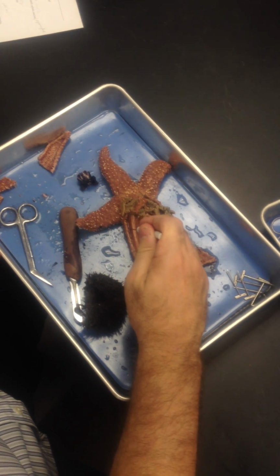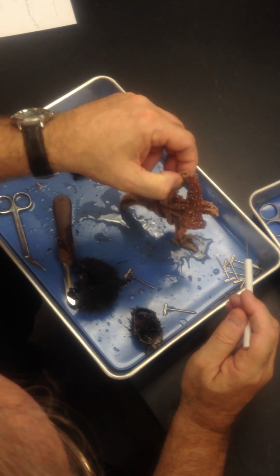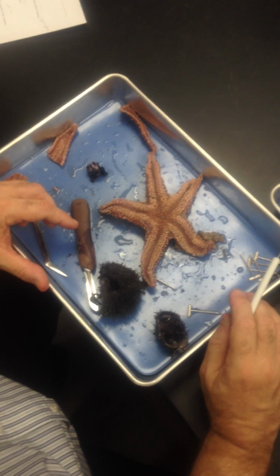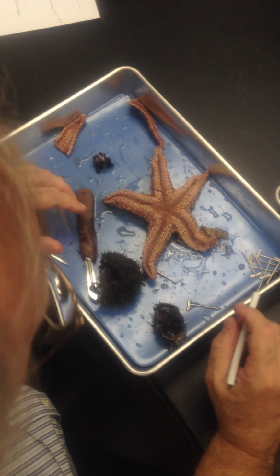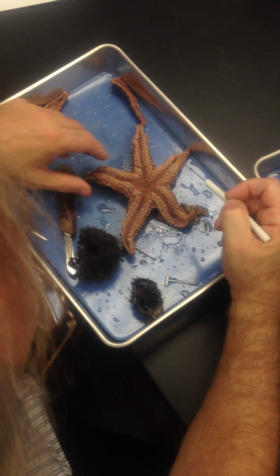And these bubble-like structures, ampullae, which force water into what? Here are your tube feet. If you've gone to the beach and you've handled these things when they're alive, there are your tube feet, used for respiration, feeding, and movement from the notes, right? We can ask it on a practical. I'm not going to go to the notes to ask everything we said in lecture, but a couple of things like, what do tube feet do?